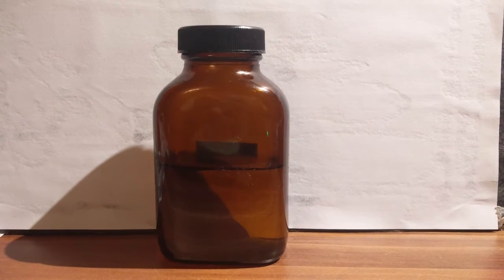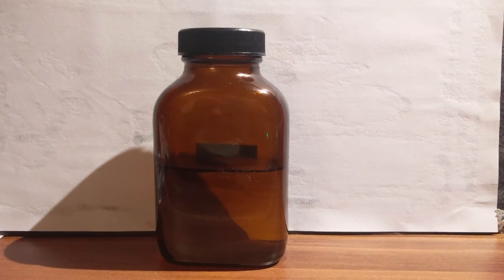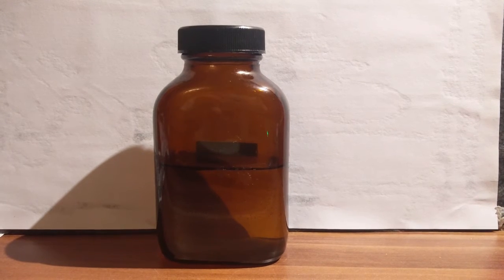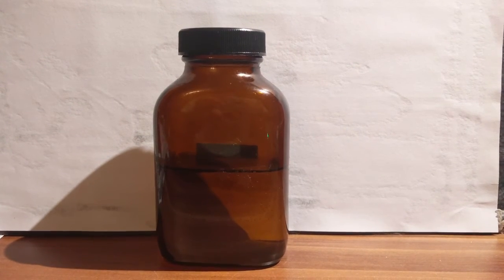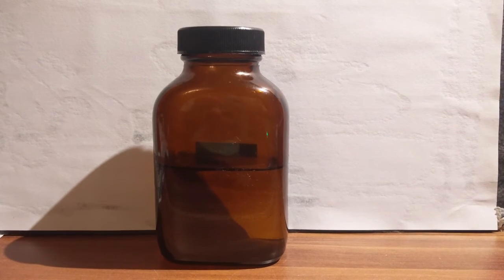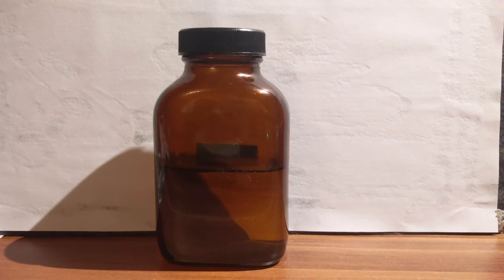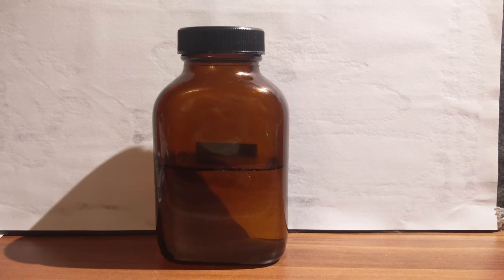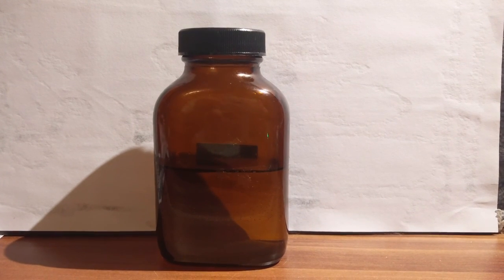Here we have it — we got about 57.43 grams of crude 52% formic acid. This represents a yield of about 57% in relation to the oxalic acid we used. This method isn't very good since a lot of the oxalic acid is converted into CO2 gas, but it does work. In a later video I'll purify my acid using lead nitrate, but since I don't have any on hand, I'll keep it for a later video. Keep doing chemistry!